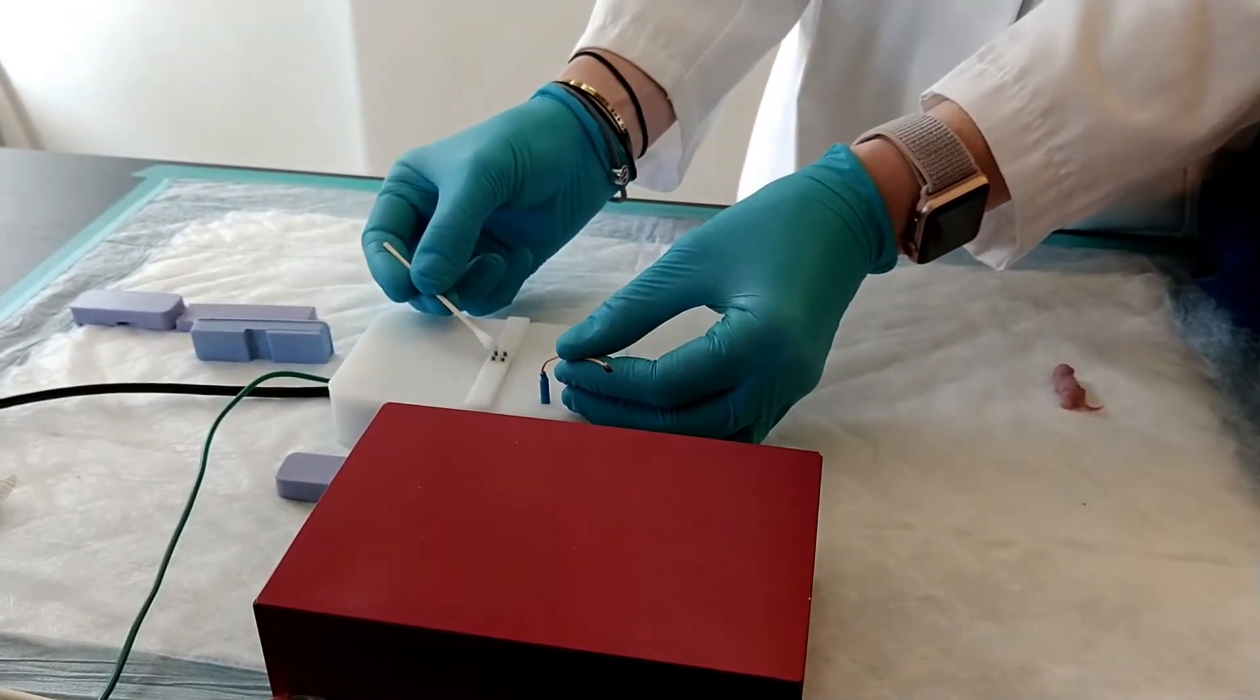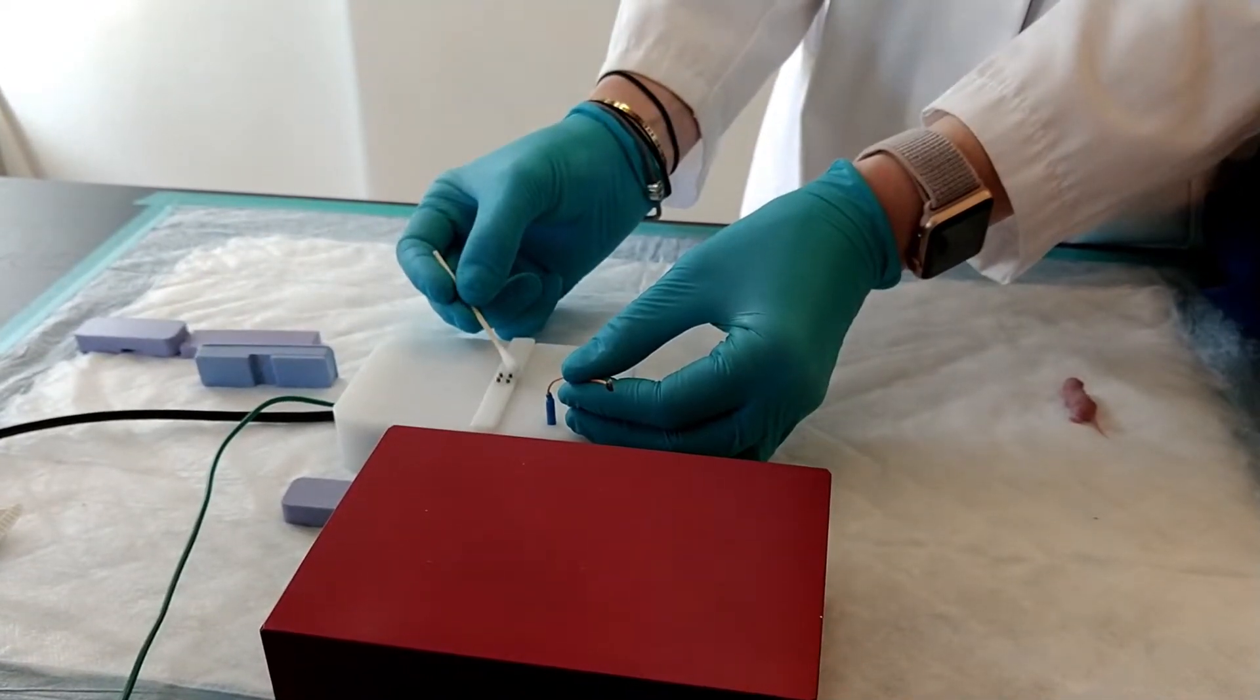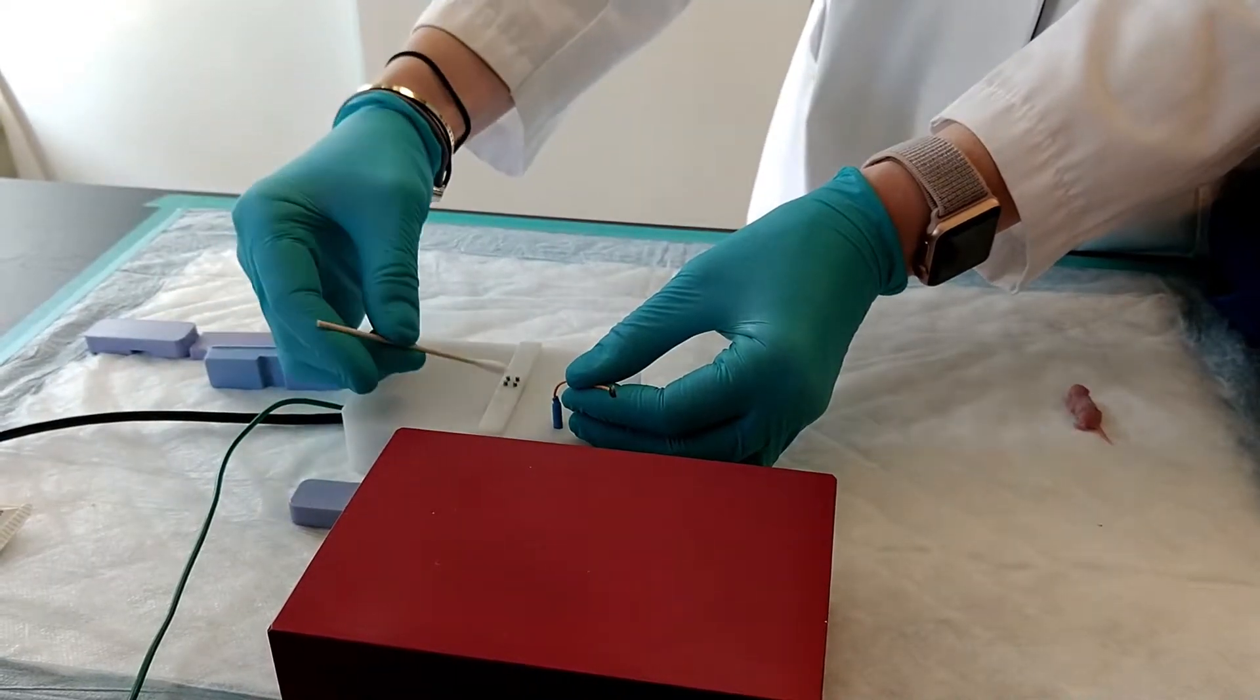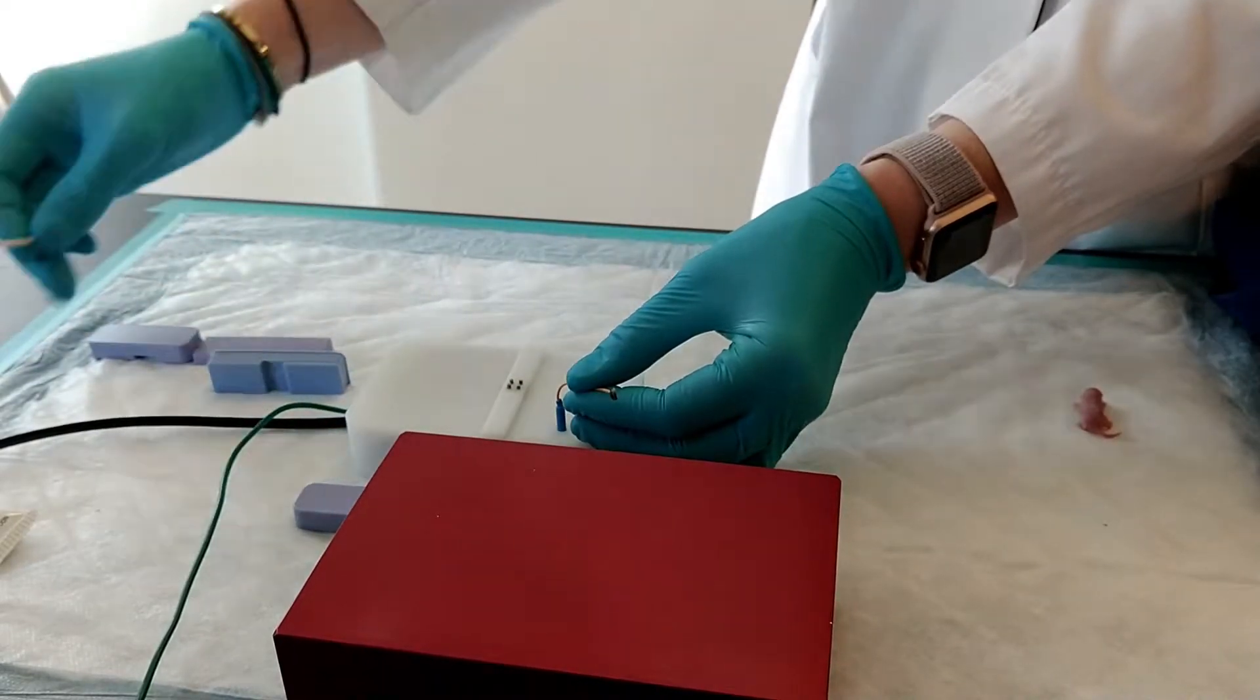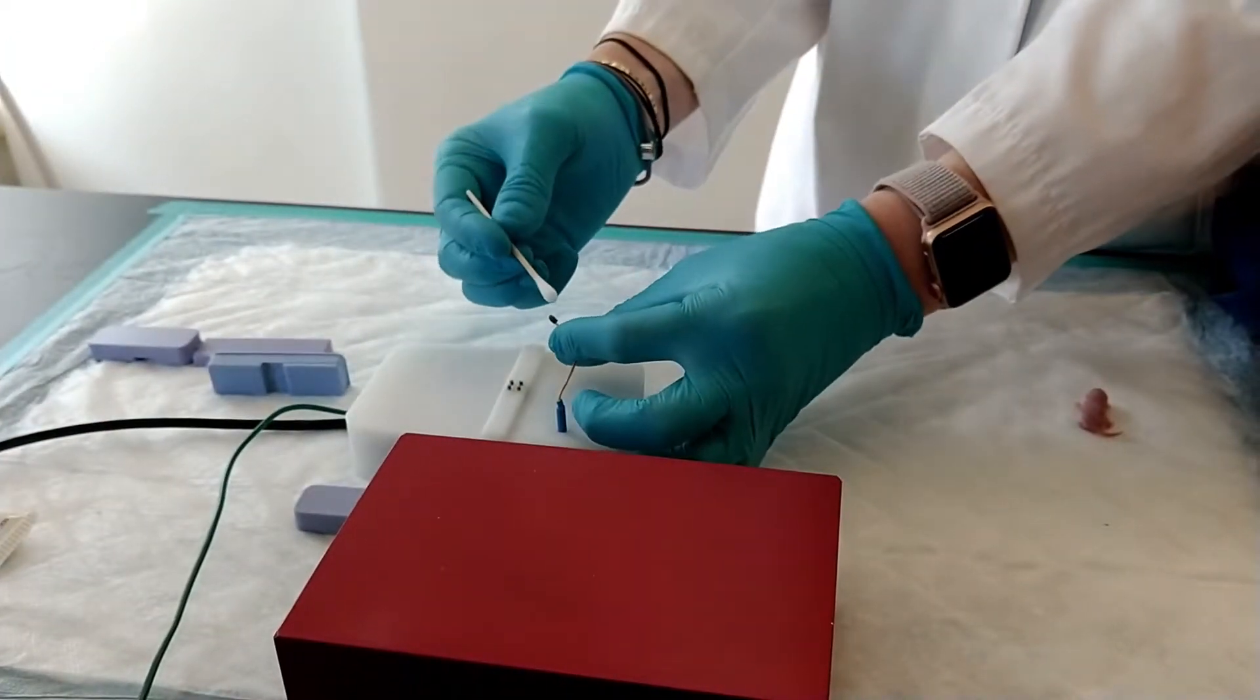Ensure that you cover each one thoroughly, and then apply it to the back electrode.